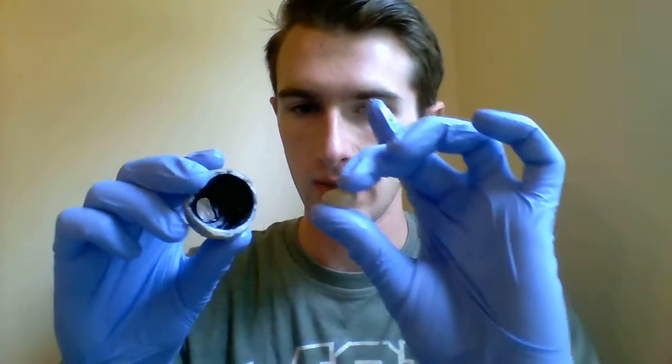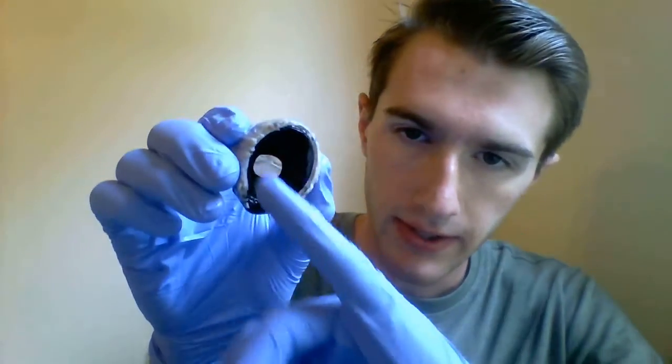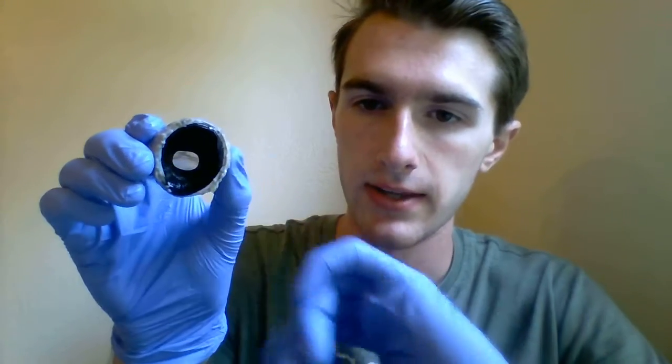If we move to the back, this just popped out. This is the lens of the eye, which normally goes right in here. If we remove the lens, we can see part of the pupil or the slit right here that leads up to the anterior cavity. Lining the edges of the pupil is the iris, and this is the part of the eye that gives it the color.